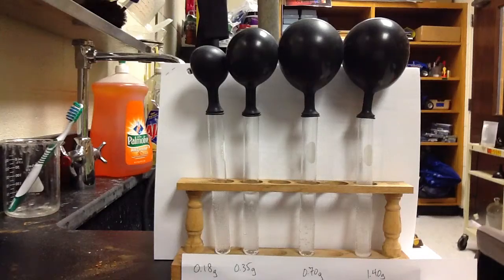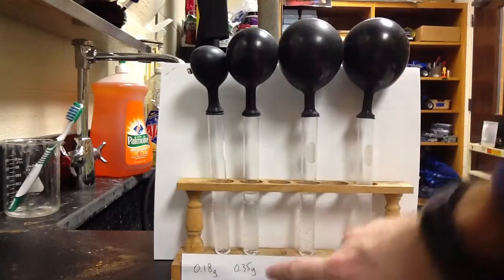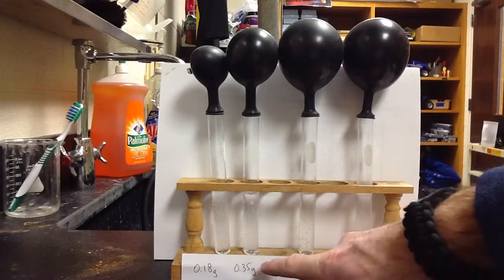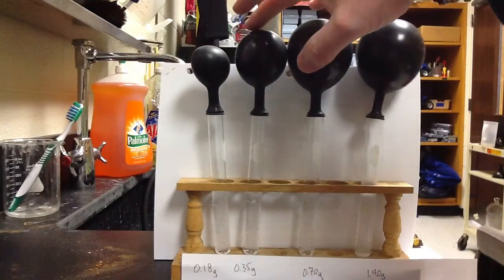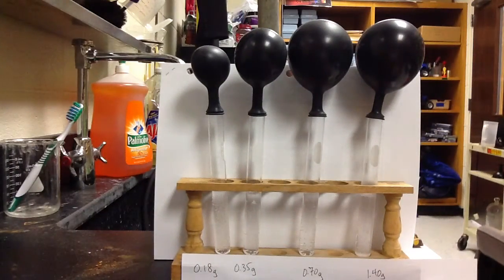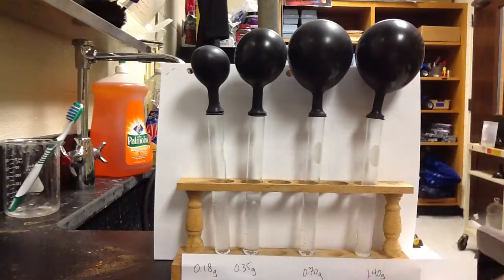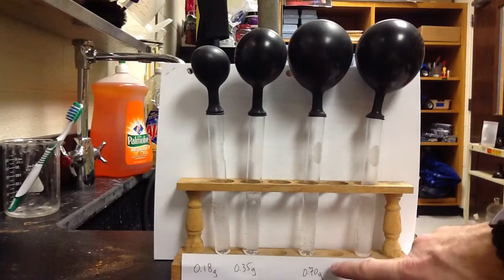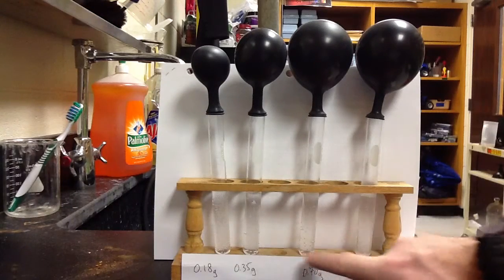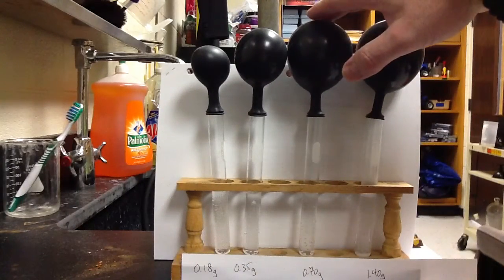But we've already sort of done that, because what we've done in test tube 2 is that we had the same amount of vinegar to start with, but we've doubled our baking soda. So from 0.18 to 0.35, we about doubled it. And because we made more gas in test tube 2, we knew that there's excess vinegar in test tube 1. Similarly, what we could do to test tube 2 to know if there's excess or unreacted vinegar in here, add more baking soda. Well, we've done that. In test tube 3, you started with the same amount of vinegar as you did in 2, but now we doubled the baking soda. So when we doubled the baking soda, we doubled the amount of gas being produced.